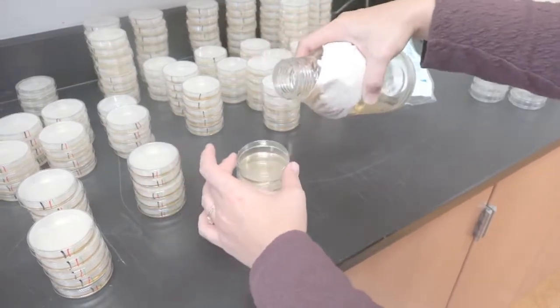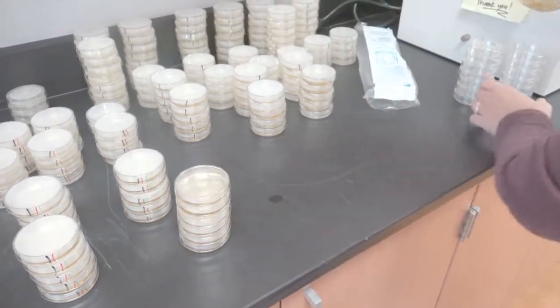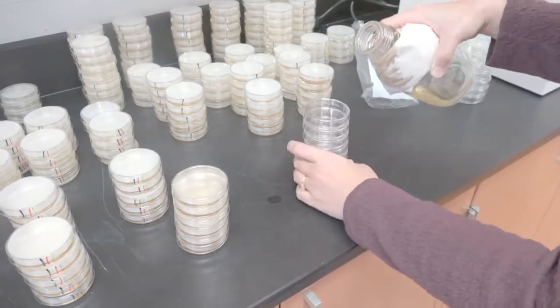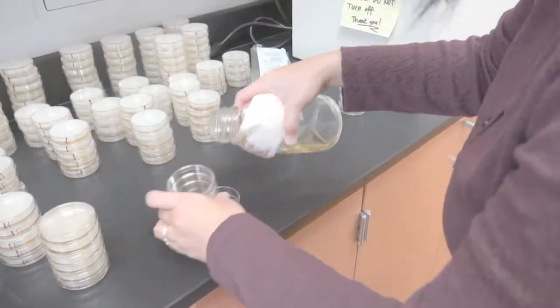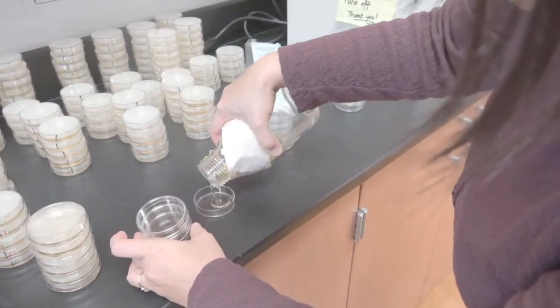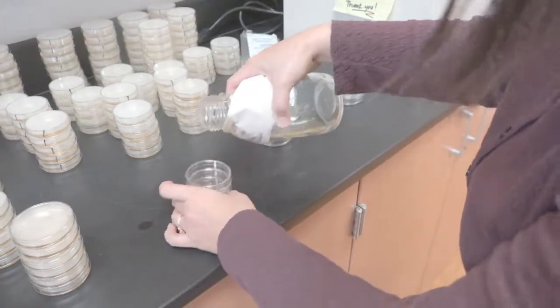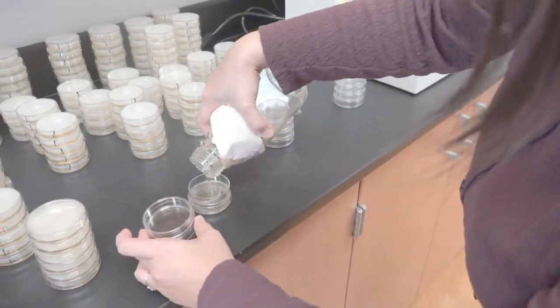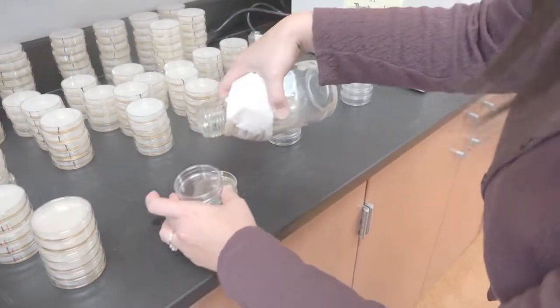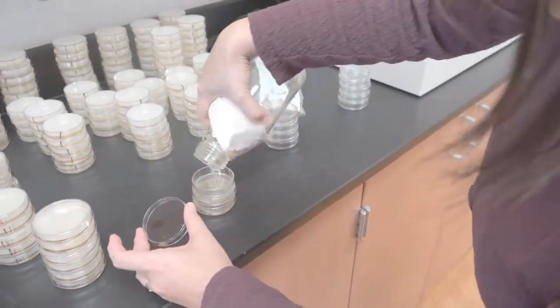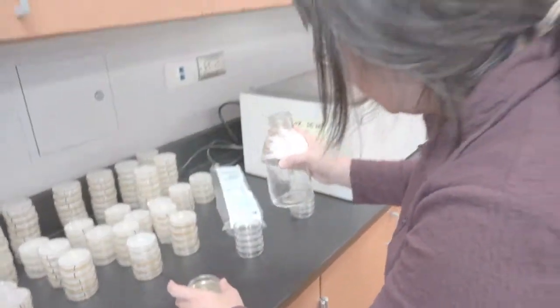I've got to remember that these guys that aren't labeled are your Arabinose ones. This is pretty much near the end of my line here. I think I have enough for one more. That's it, that's my bottle.